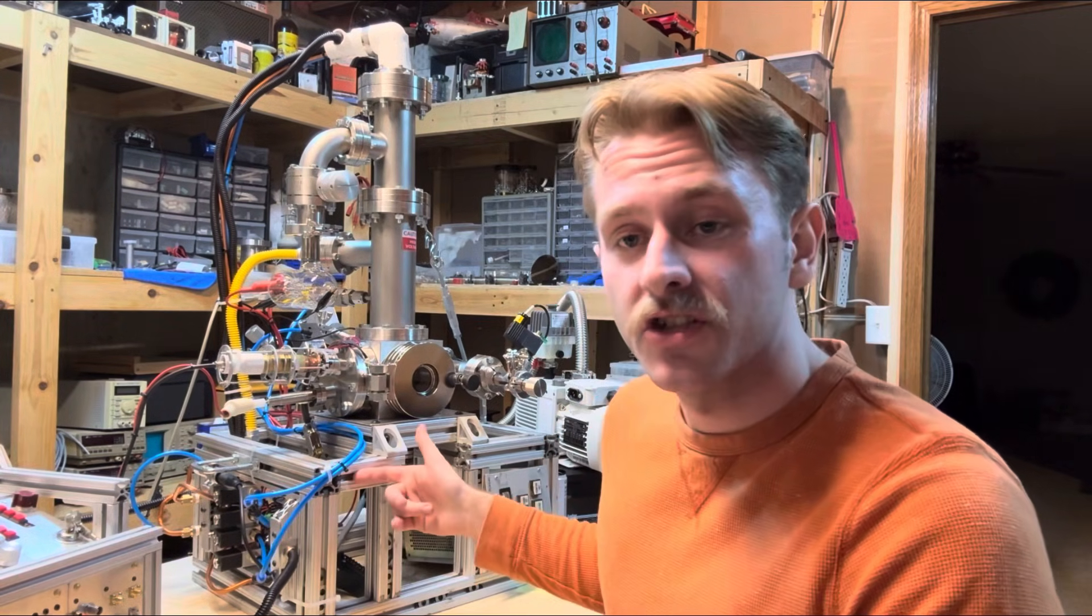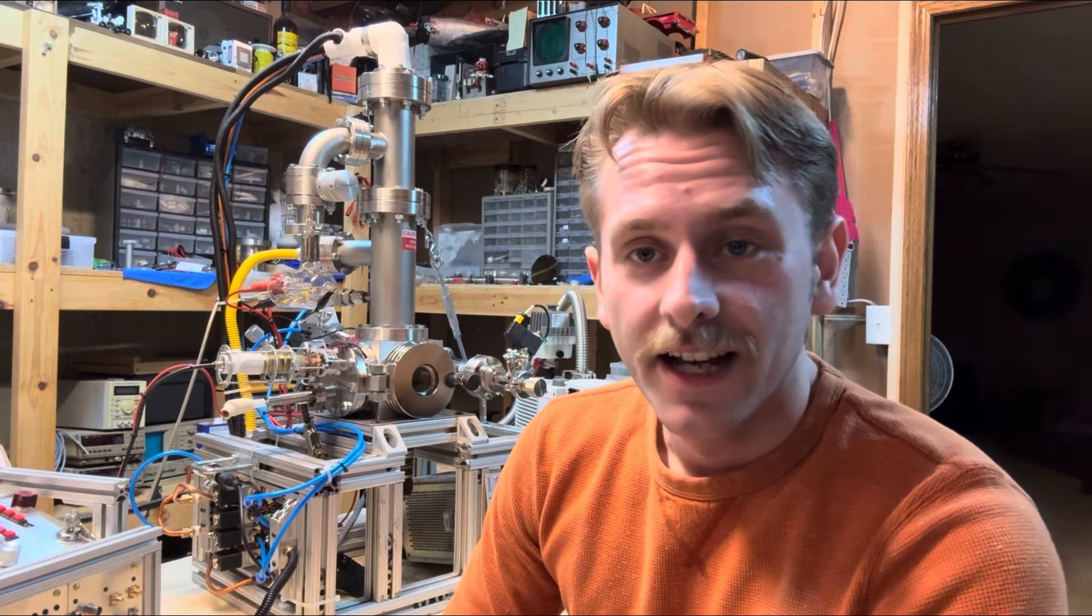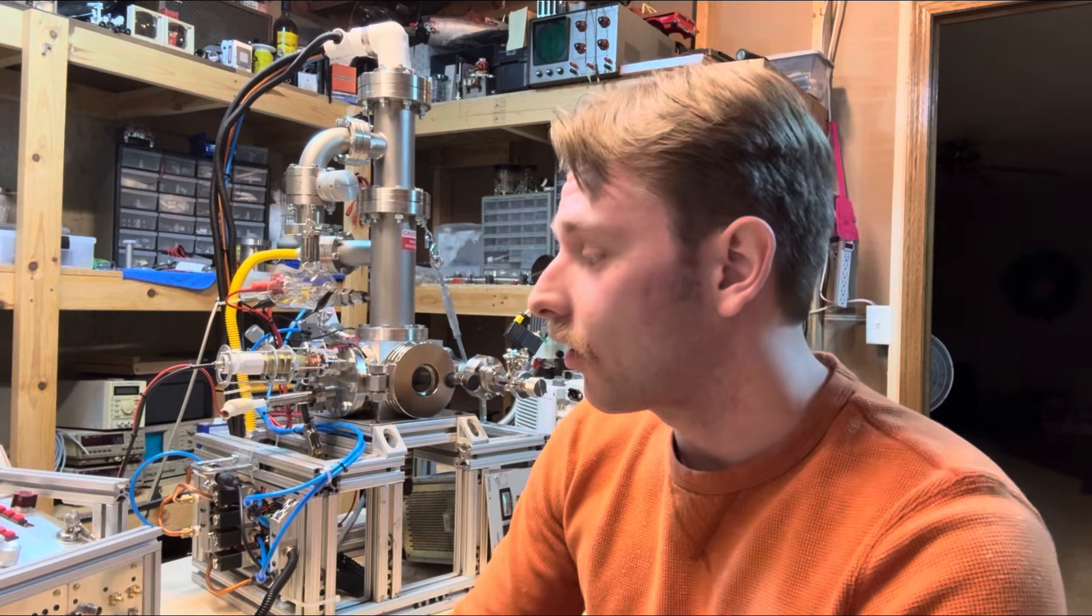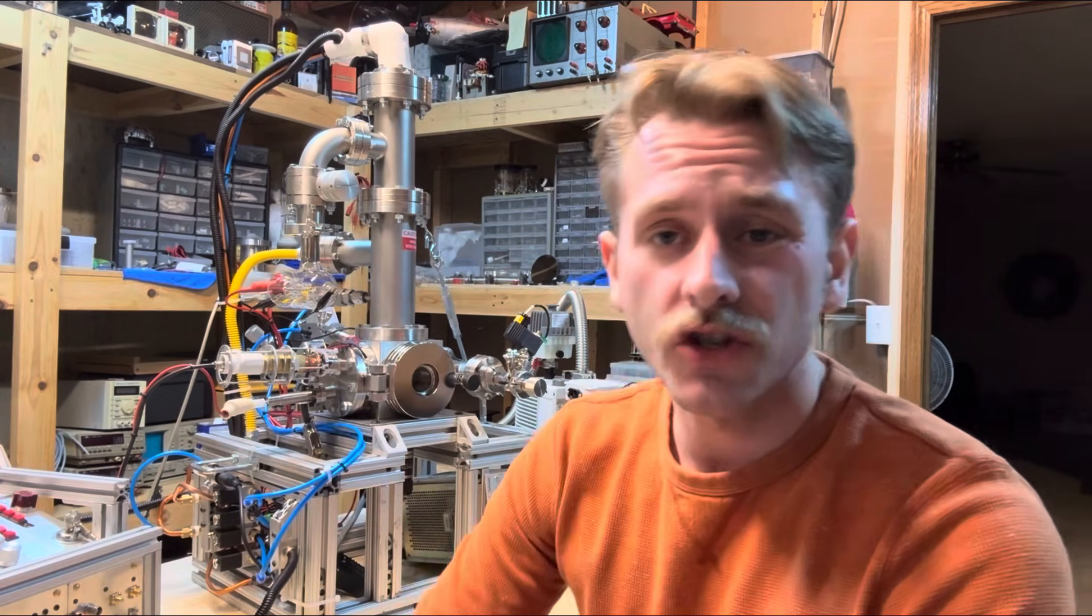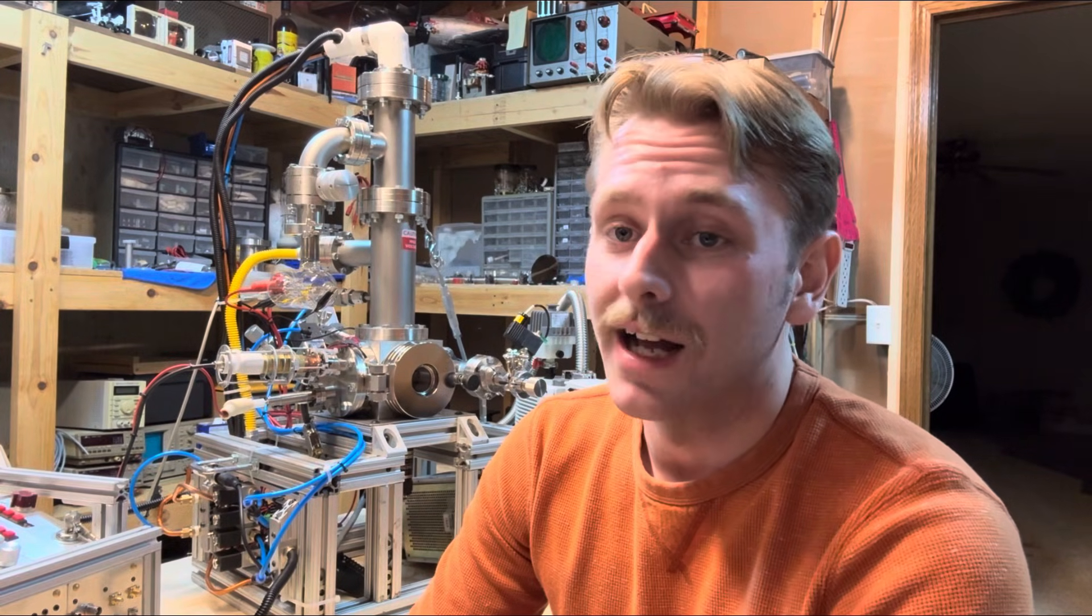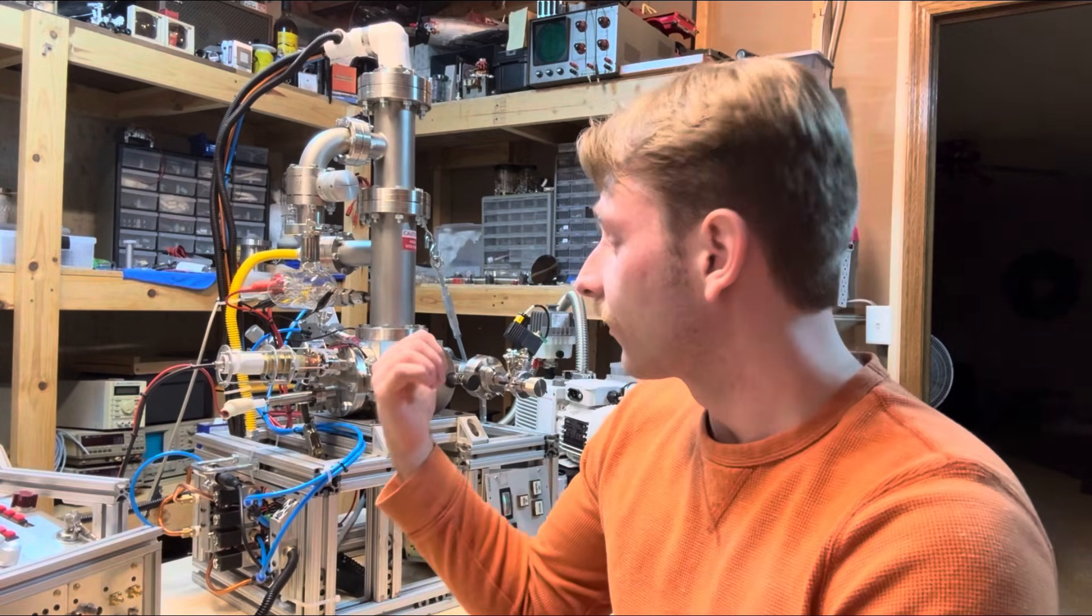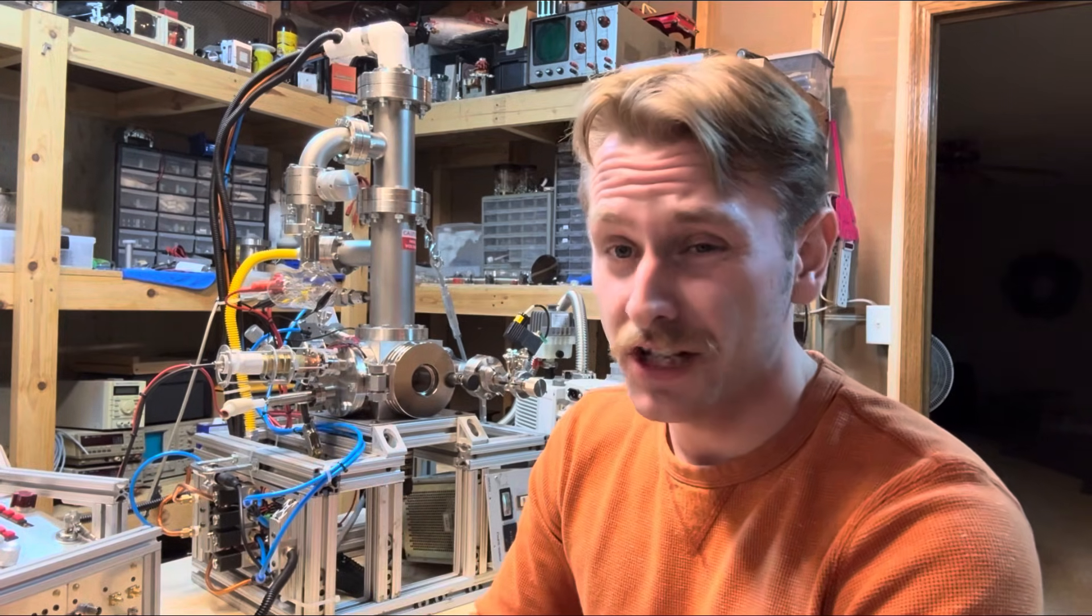Most of this thing is made out of aluminum extrusions. I went to the scrapyard, and they just had a bunch of aluminum extrusions. I got all these extrusions. There's probably like 100 feet of extrusions here. I paid like 30 bucks for it. I got really lucky there. I even got some ConFlat parts on Facebook Marketplace for really cheap.